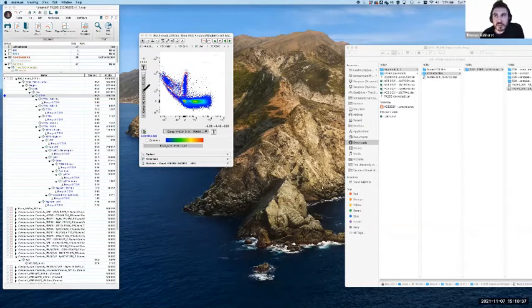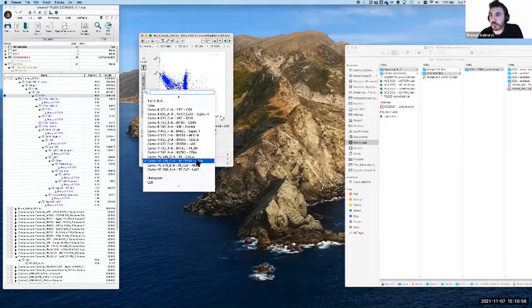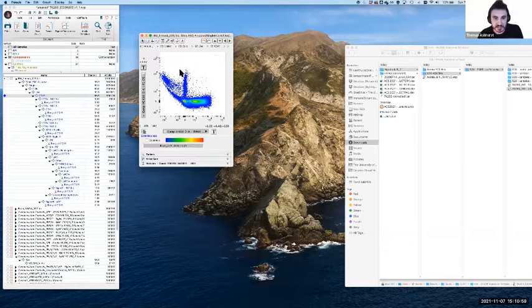So this isn't the offending fluorophore, but whatever is happening is related to this fluorophore. Now, in this case, we can probably assume a couple of things. One is that if we know what marker this is, that might give us some clues as to what's going on. If we have a little look, that should be CD3. So all of the events that are being moved around are CD3 positive. And this actually gives us a bit of a clue. It's not CD3 that's the culprit, but it's something expressed on CD3 positive cells, T cells.